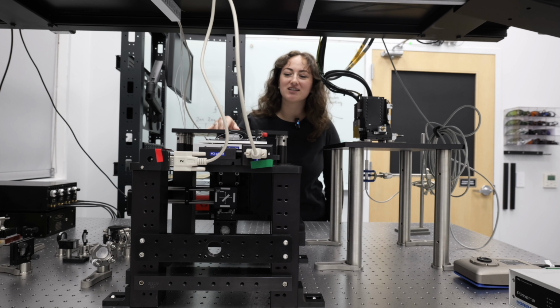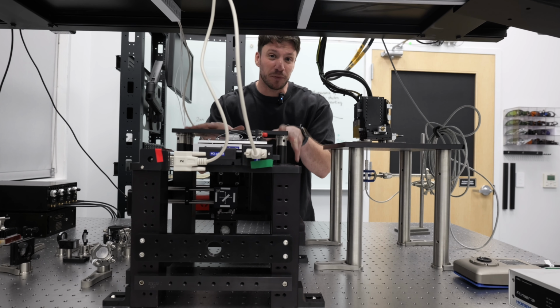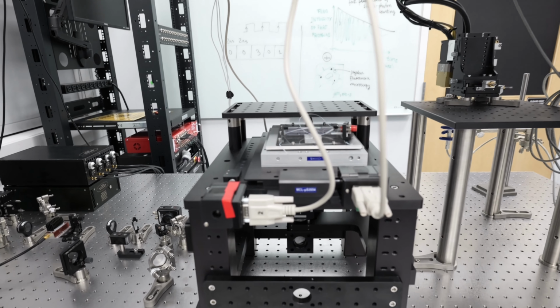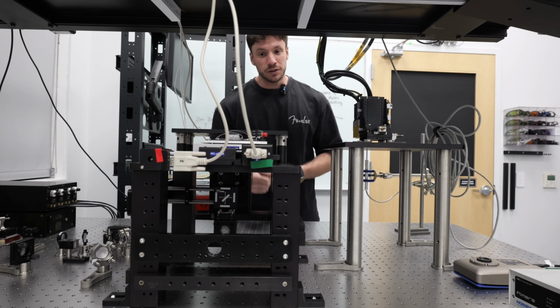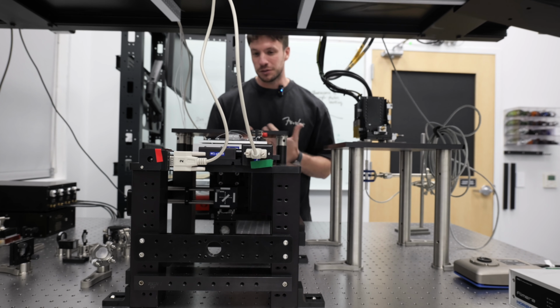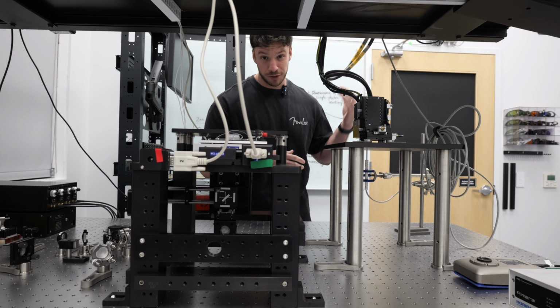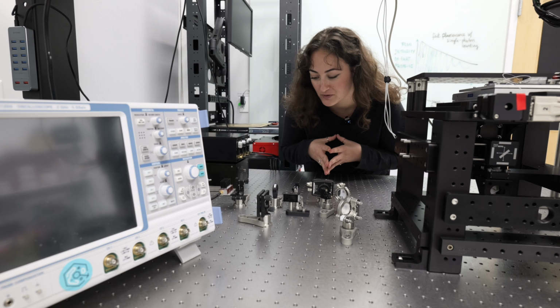This whole situation here, it's not really important. We'll move on. This is the most important part of the microscope. This is where the samples are going to be. And there's a stage that we can control so that we can scan the samples, and also you can apply light in a very particular way that is called total internal reflection fluorescence microscopy. And on top of that, we'll position the magnet once I've done the calibration. So these are the pieces of the quantum microscope.